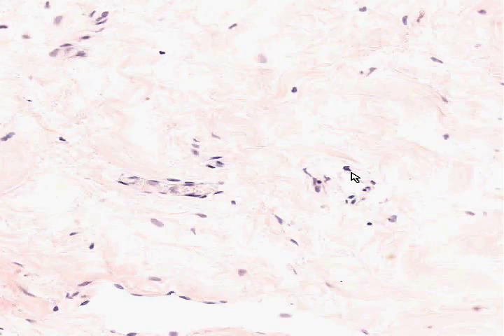And once again, I will ask you before we close, do you feel that you can really identify absolutely everything within connective tissue? If the answer is yes, then we have fulfilled our mission, and that's what we plan on doing with all of these slides.